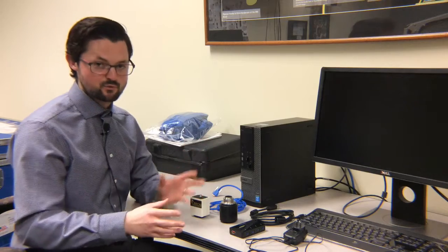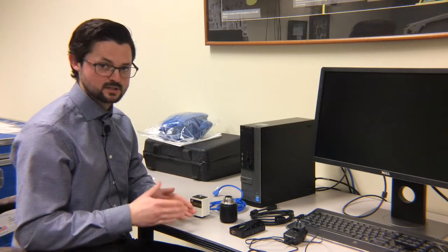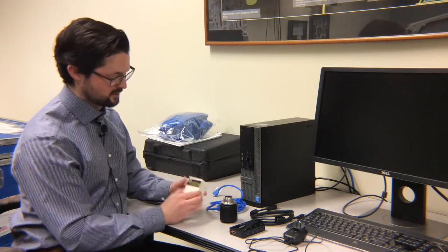Okay, so the first thing to do is just go through and make sure you have all the parts of your new camera. You have the new camera which is here.